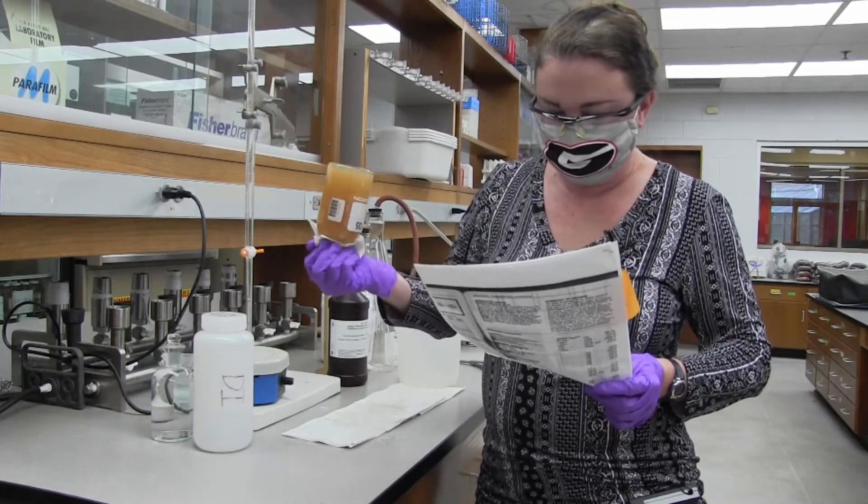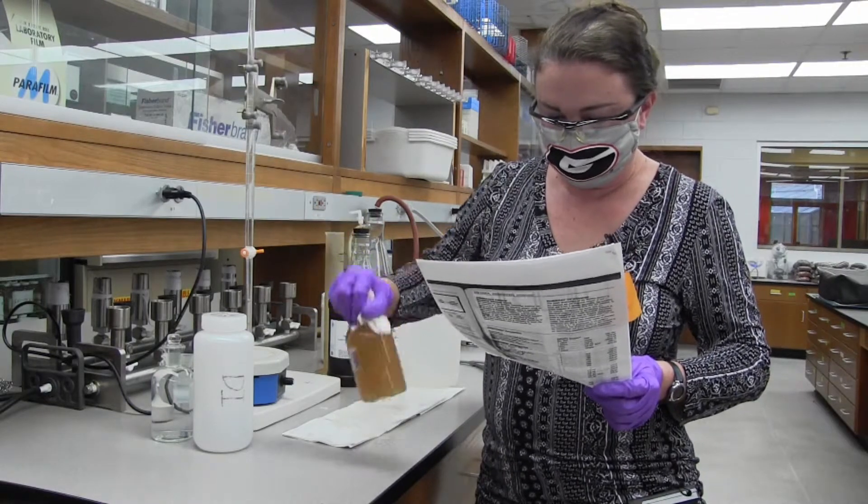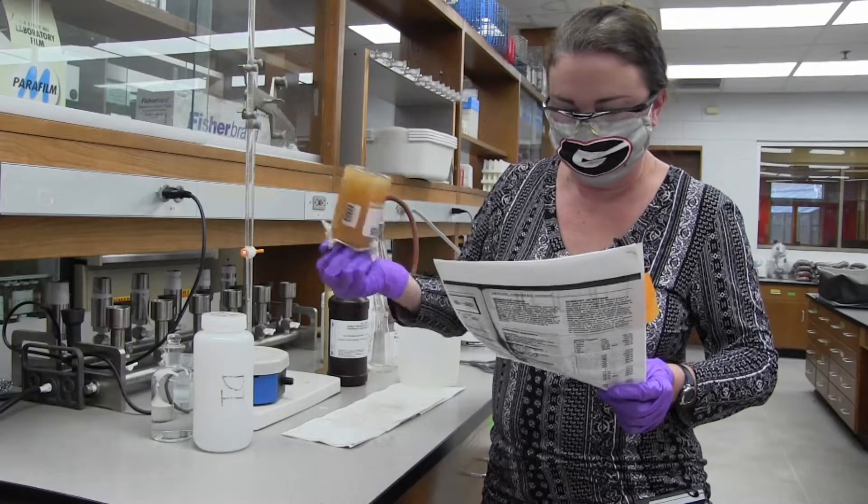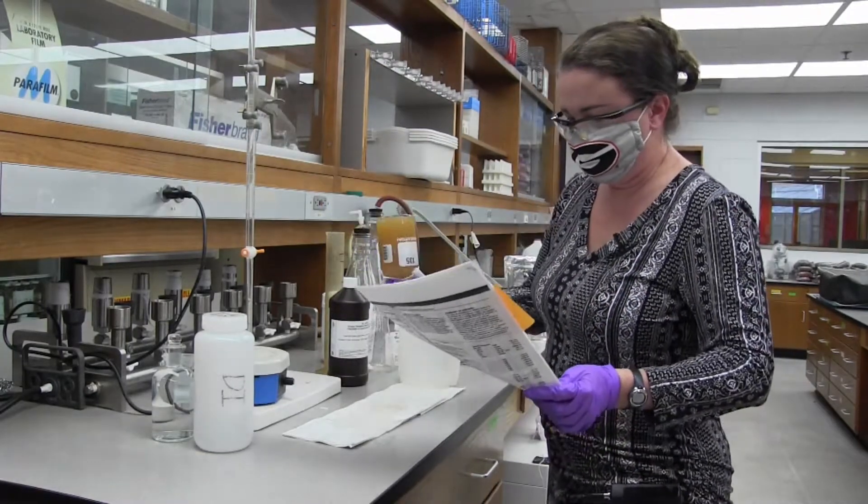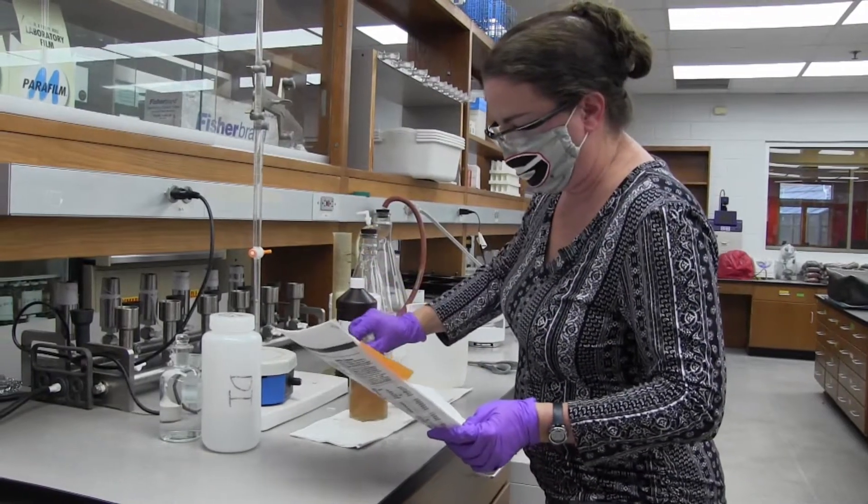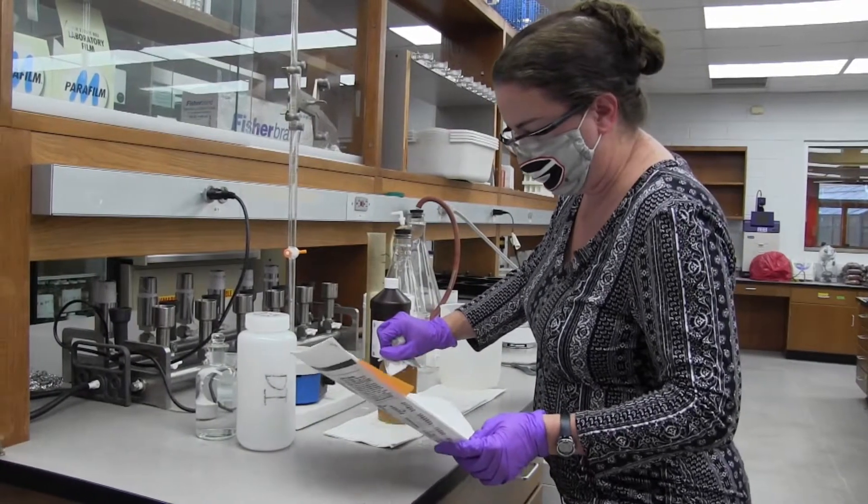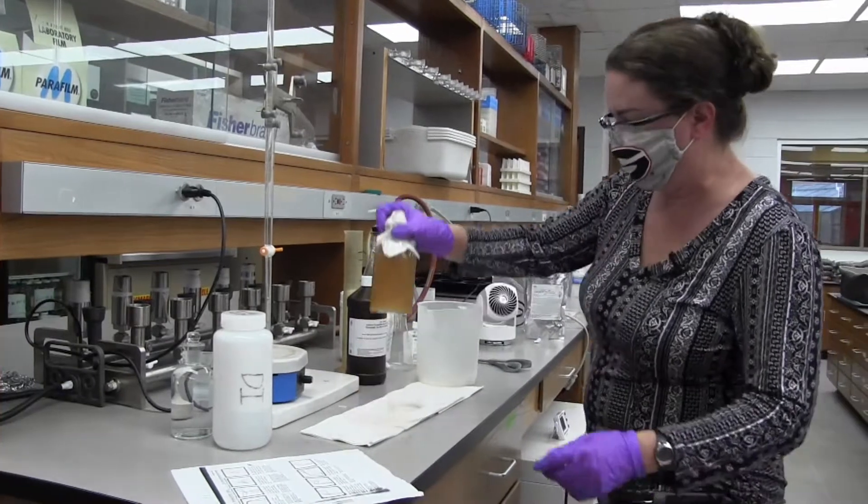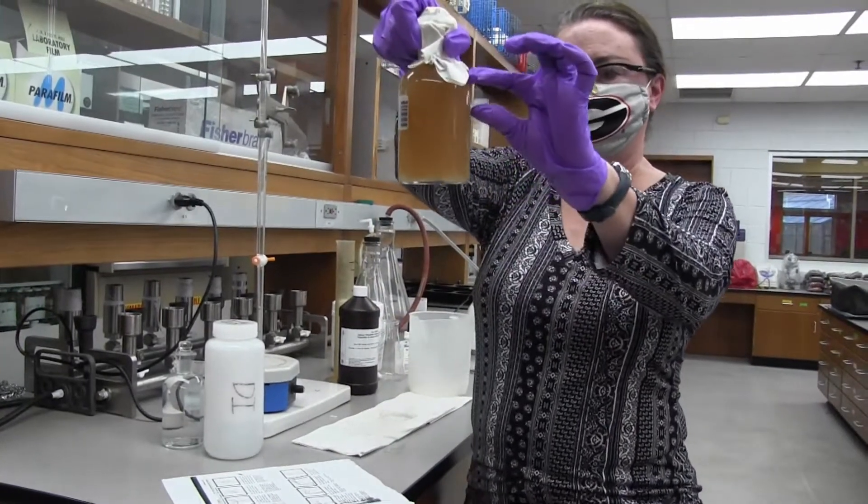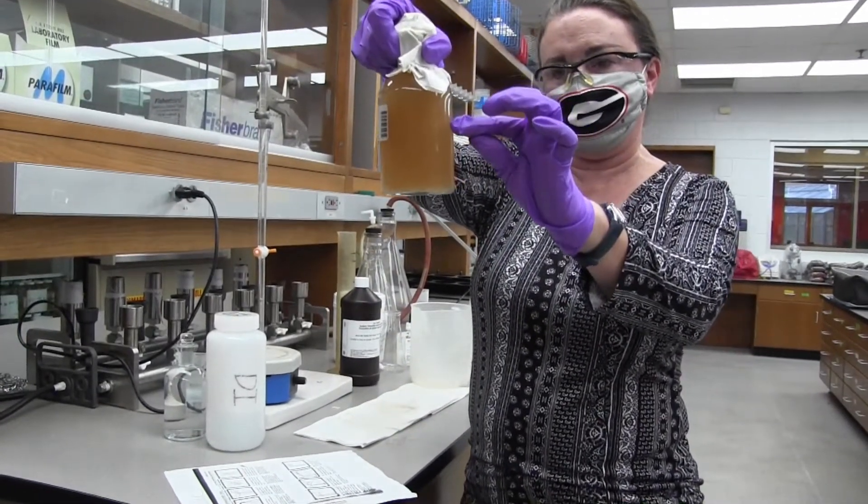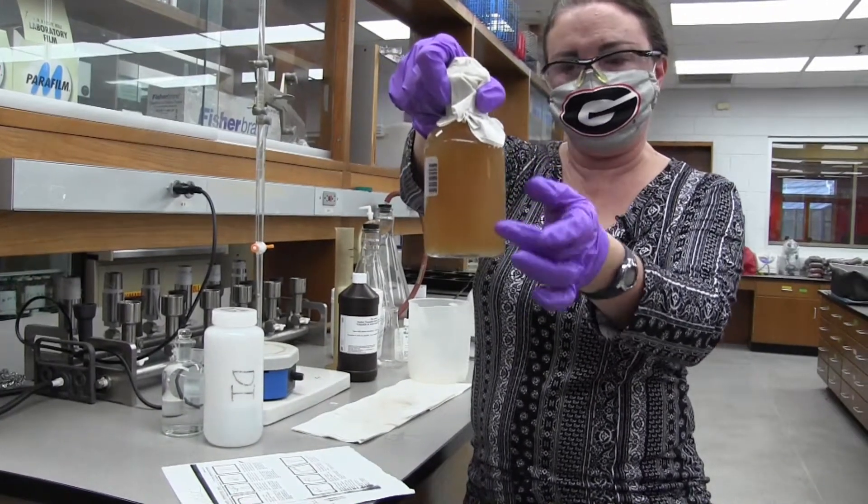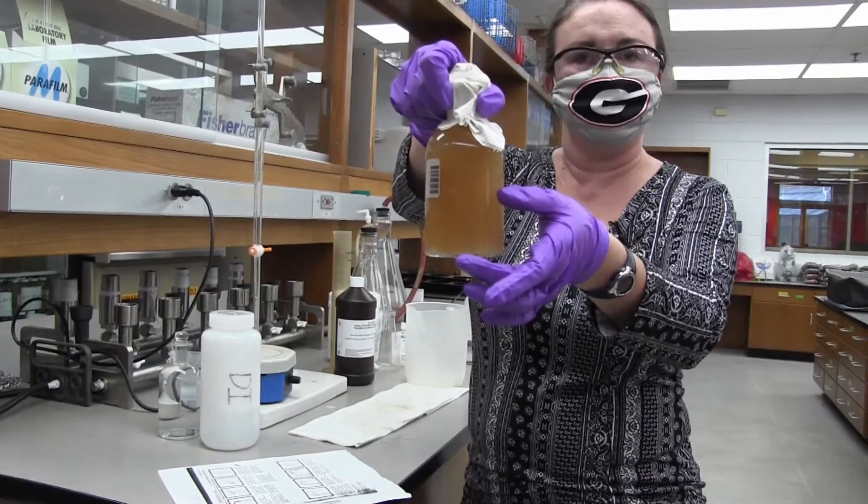The flock will settle very slowly in salt water and usually will require an additional five minutes before proceeding with step five. So now we're going to wait until the flock and the solution has settled. I'll wait until it gets down to settle down to here, and the top part will be clear and the bottom part will still be orange brown.